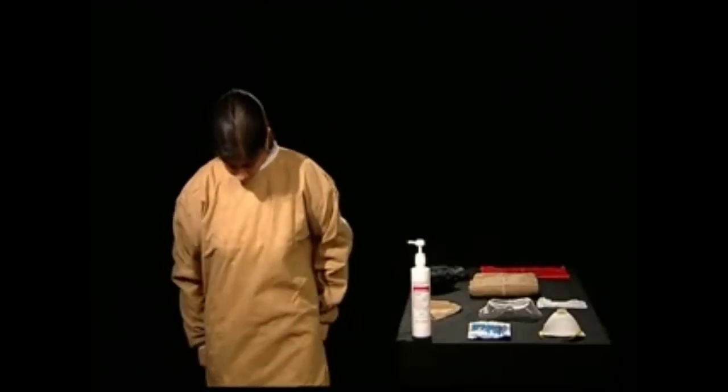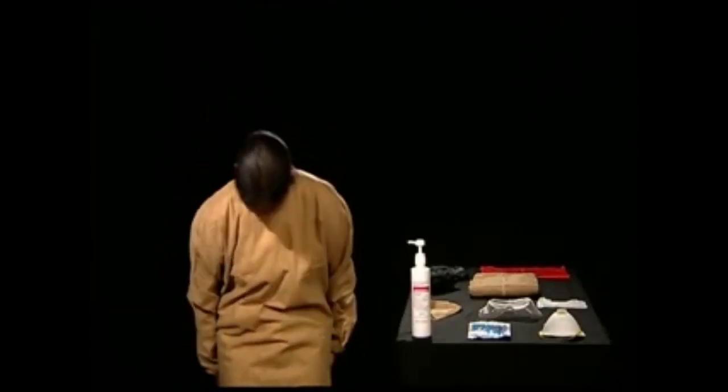Straighten the gown around the neck, cuffs, and overall to be certain that it fits well. In case the gown is small, use two gowns to cover any place which could be exposed.